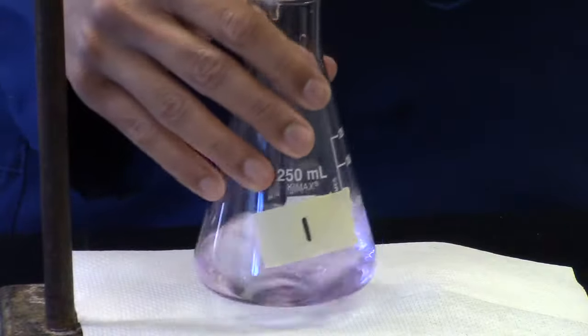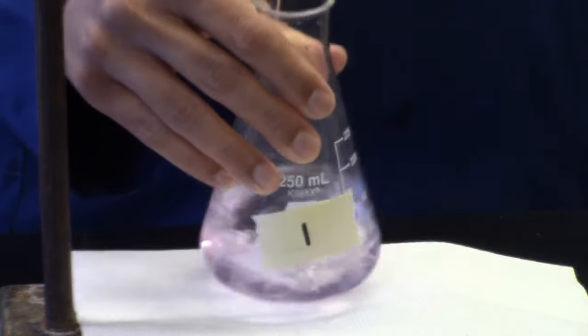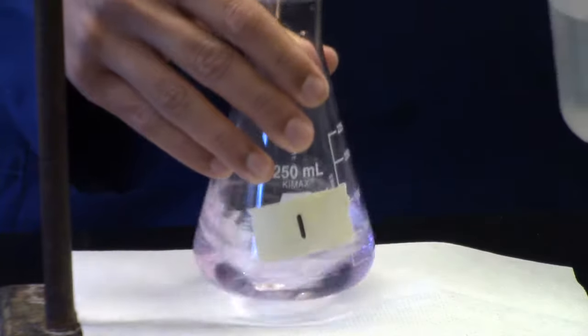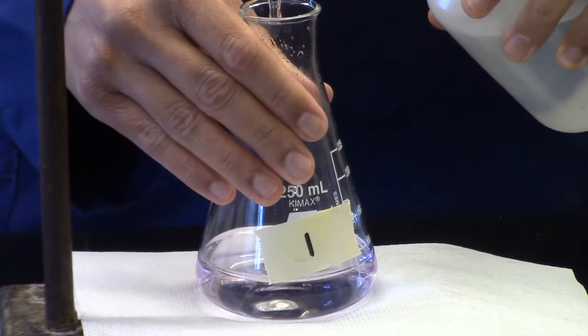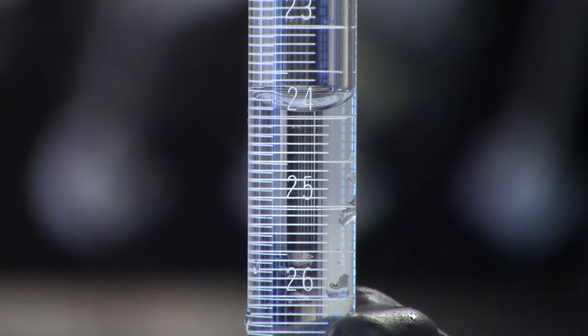Titrate the unknown sample to a faint pink endpoint. Record the final burette reading.